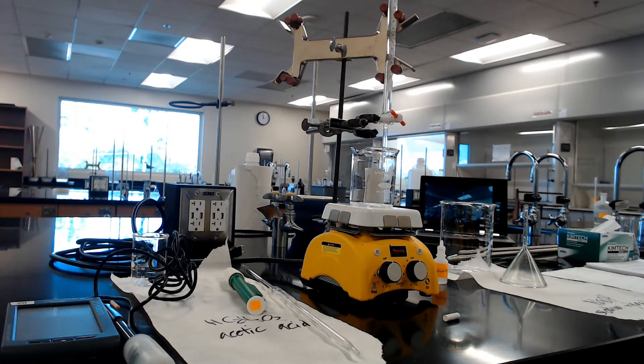Alright class, good afternoon. We're going to do the pH meter titration lab. It's in three parts.